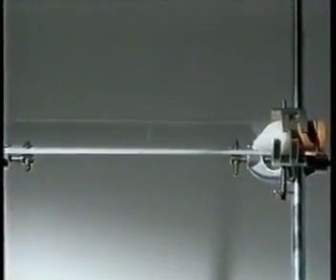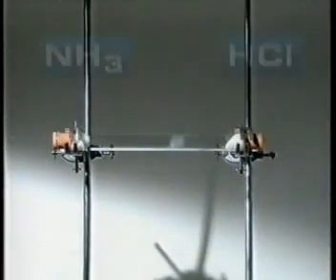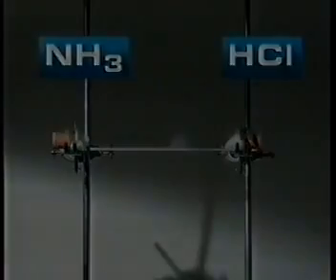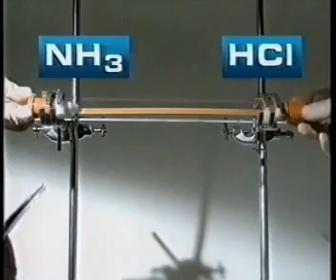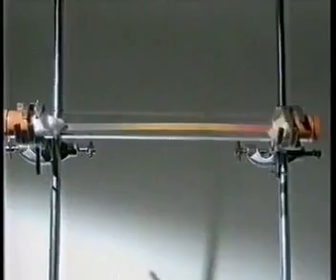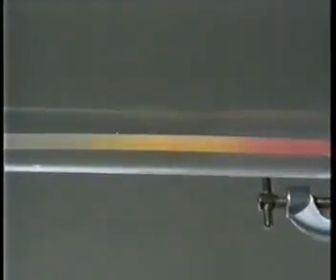You can compare the speed at which they approach each other by looking out for a cloud of ammonium chloride. After less than a minute, a white ring begins to form, marking where the gases meet. The white solid is closer to the hydrogen chloride end of the tube on the right — so which gas has travelled faster? Another way of monitoring the progress of the gases is to run a piece of damp indicator paper along the tube. Hydrogen chloride gas turns it red; ammonia turns it blue.